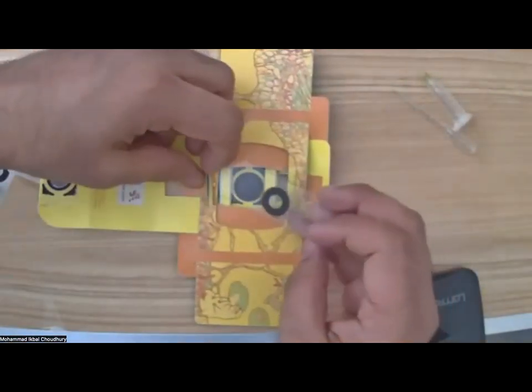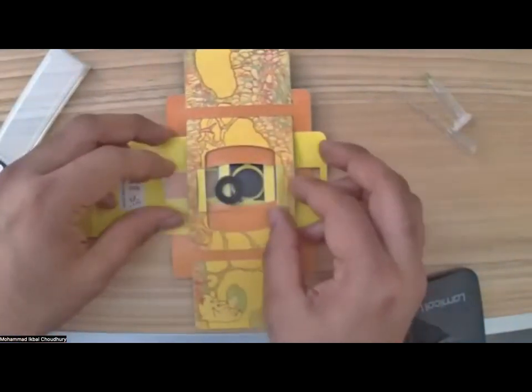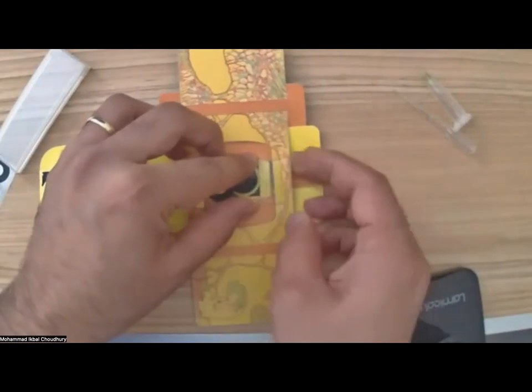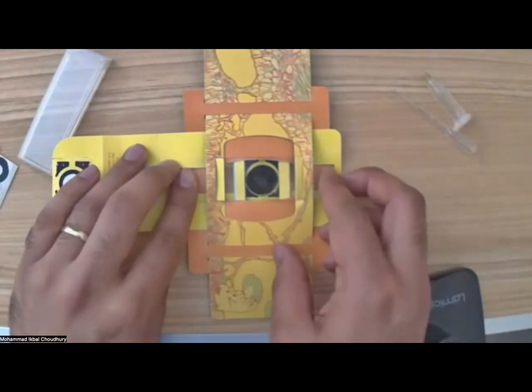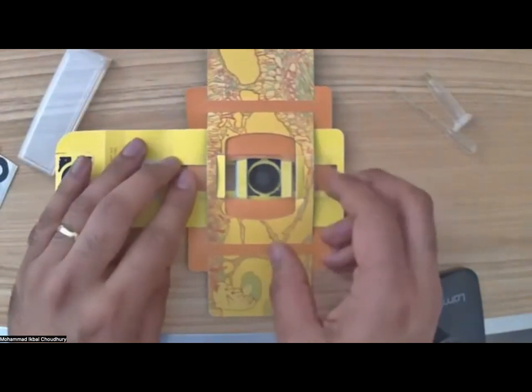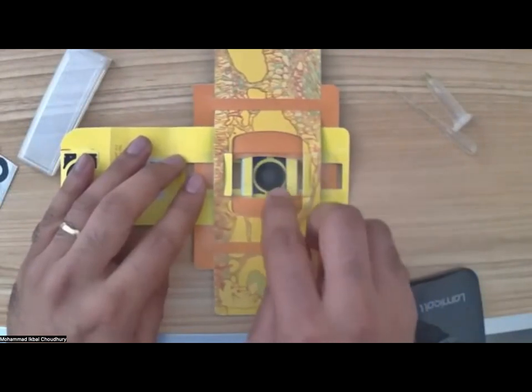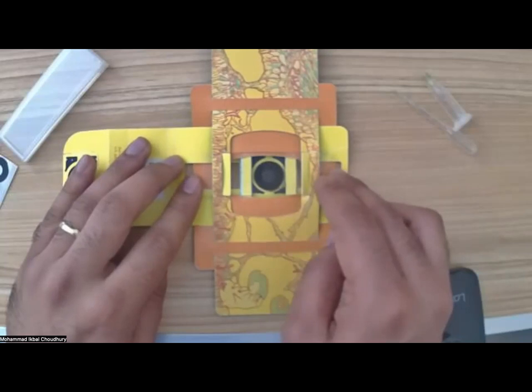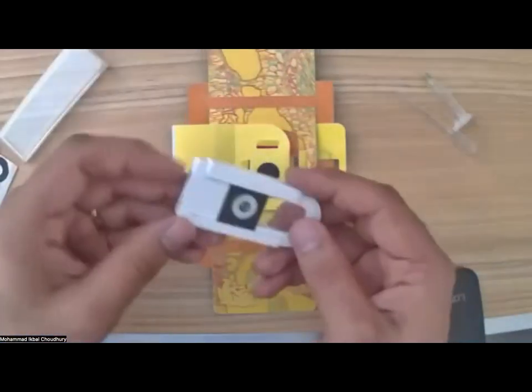So you take this flap up, slide it in, move it forward, take this flap up again, and slide that side in. Okay, now there is no well-defined spot for my sample, so I'm going to hover all over the sample. What I did is I placed the center of the ring sticker, aligned it with the lens, and just covered it up.